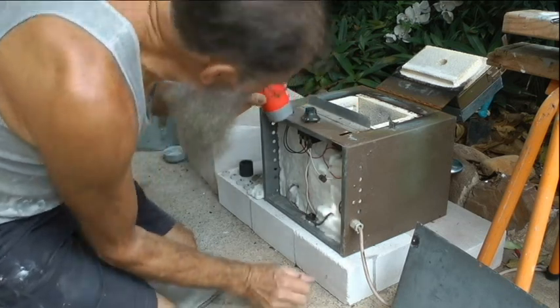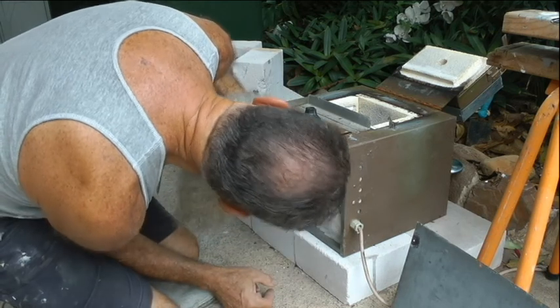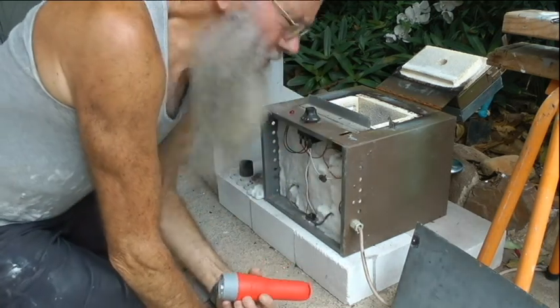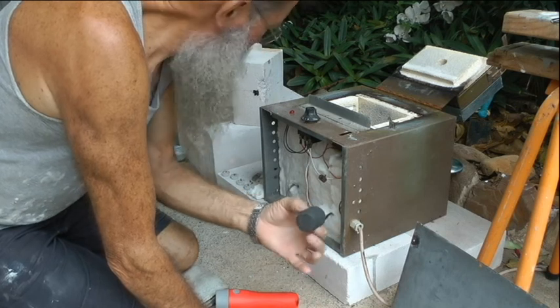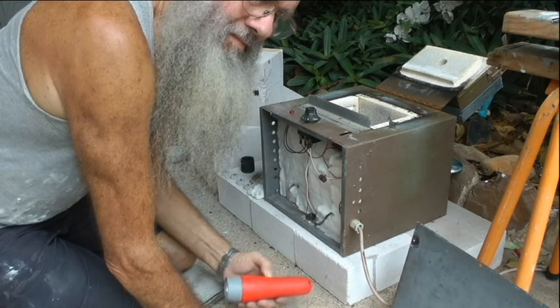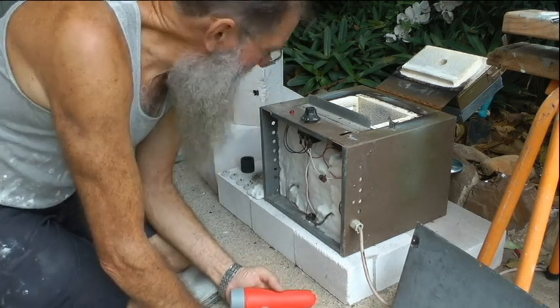Damn, the muffle furnace is broken, not working. I don't know why, if it's the switch or what. It was going really well, and I had this thing in there. It was glowing white hot, and it just stopped working. I think it's had its day.